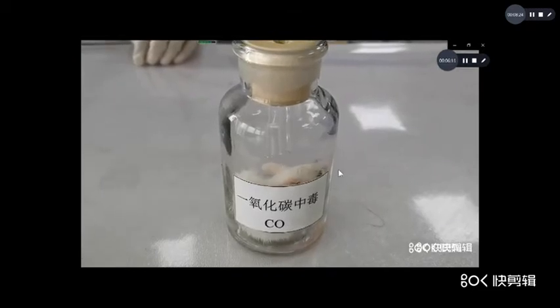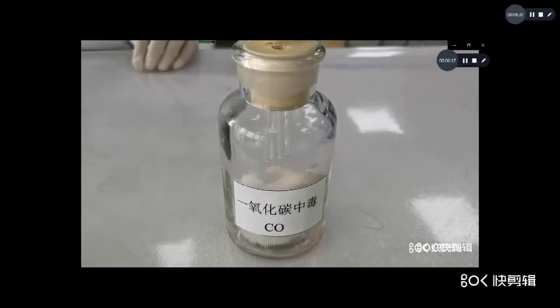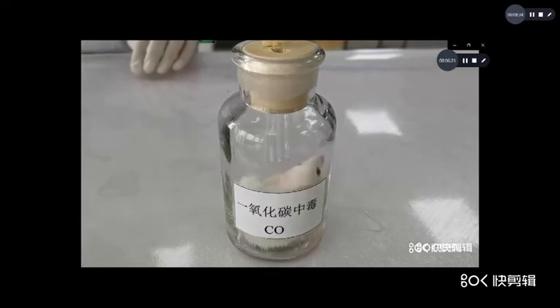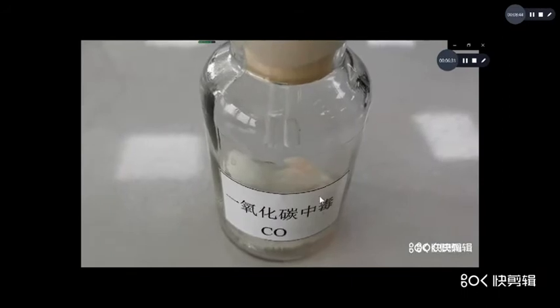You observe the color. What color? Cherry red. Now the mouse dies.